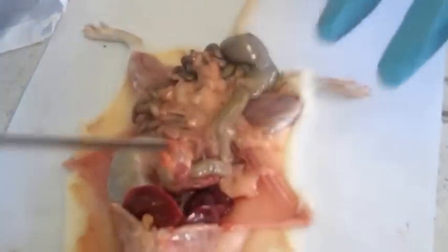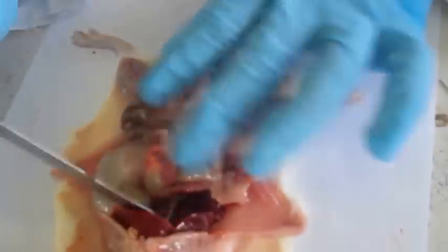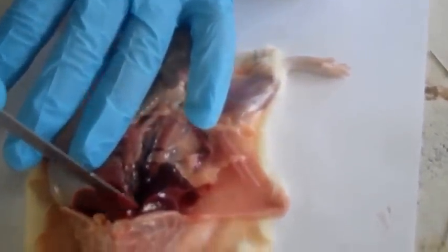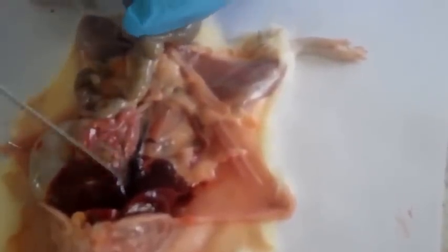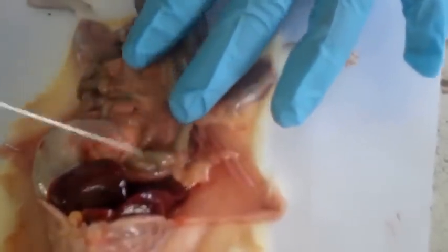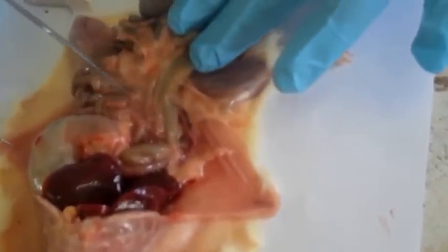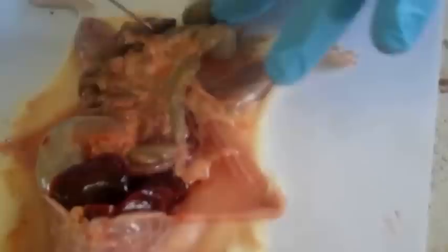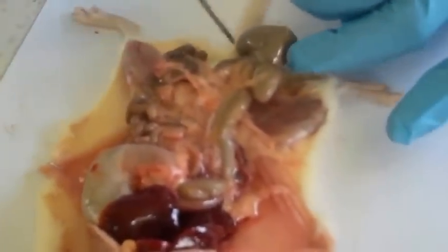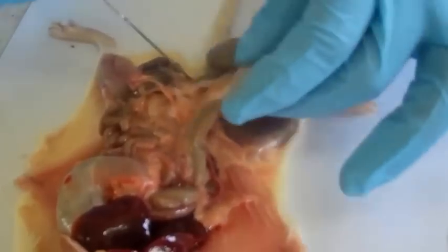So when we displace our liver anteriorly, we see the bile duct that's from the liver. This is our bile duct. Then you also see the hepatic portal vein that we all know carries the blood from the ileum to the liver. And the hepatic portal vein moves down, and these are its distributaries that you see, of the hepatic portal vein. Yeah, then this is our colon.